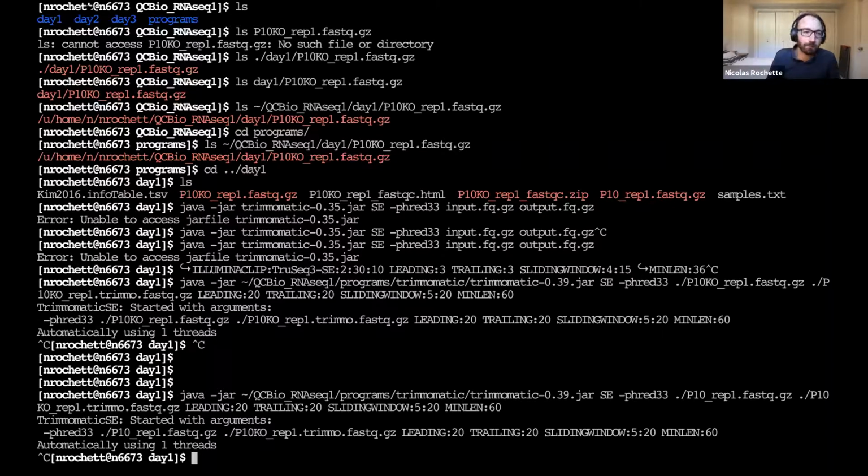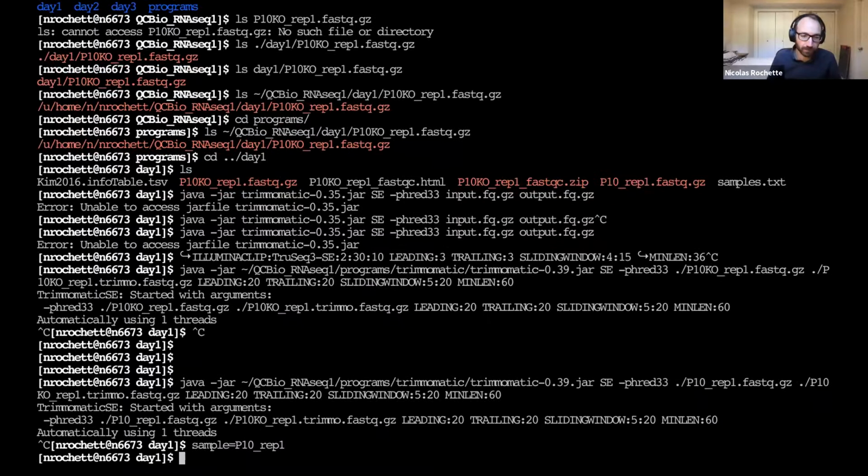And so one way we can do this is actually to use shell variables like this. And now we have stored our sample name inside this sample variable, which is really just a shortcut name for getting to the sample we're currently working on.